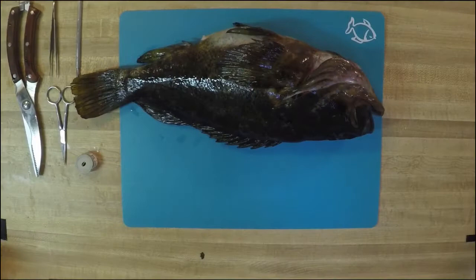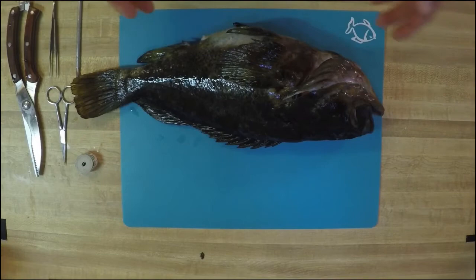And today we're going to walk you through a fish dissection. This fish we have in front of you is a rockfish. Now there are a lot of species of rockfish. This one is known as a grass rockfish. It was caught in a very sustainable manner, which means no other fish was harmed as we were trying to catch this one fish.